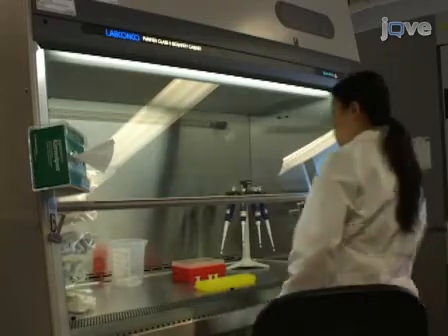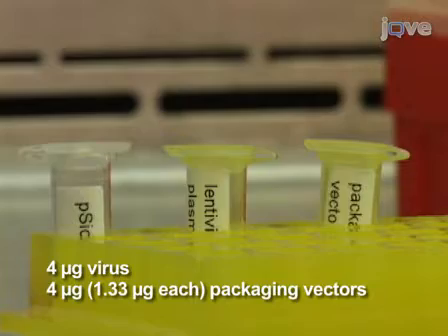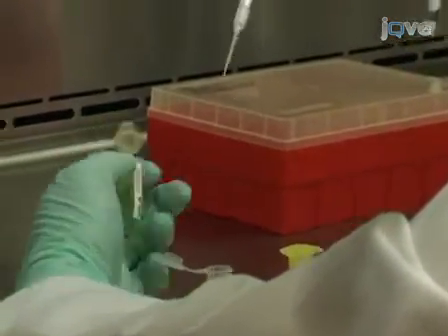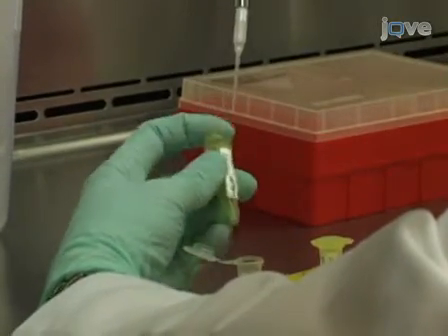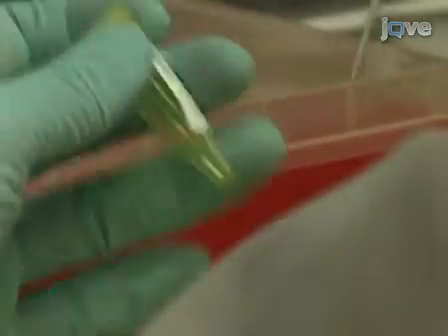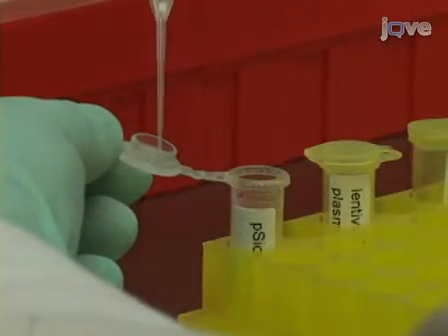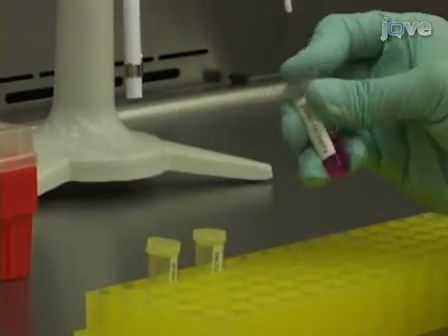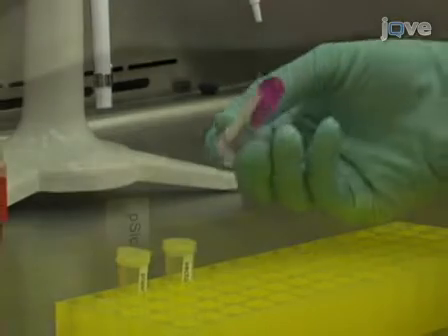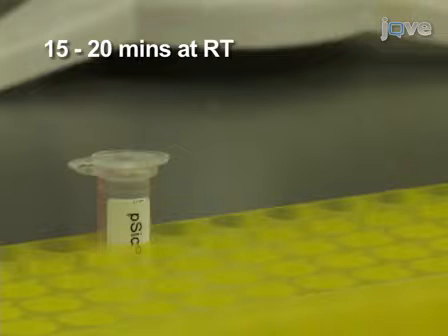Next, in the cap of the tube, mix four micrograms of lentiviral plasmid with 1.33 micrograms each of third generation viral packaging vectors. The lentiviral plasmid contains the DNA the virus will insert into the genome of every cell it infects, while the packaging vectors contain genes for all the other proteins required to make a lentivirus. Close the lid, mix by inverting the tube a few times, then incubate the DNA and transfection reagent for 15 to 20 minutes at room temperature.